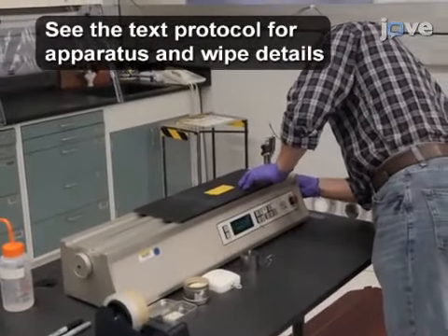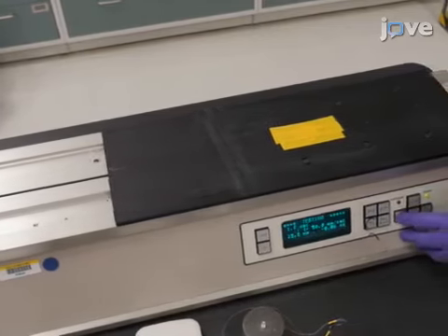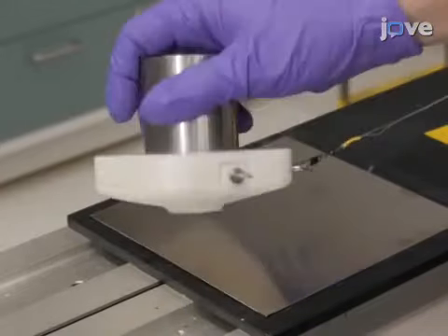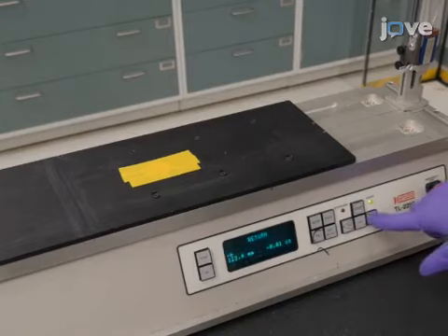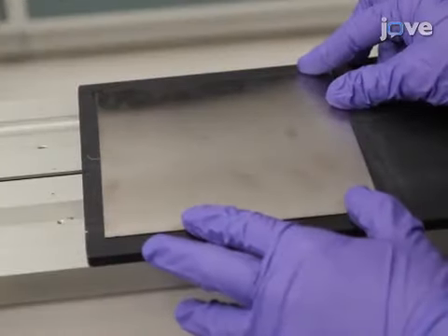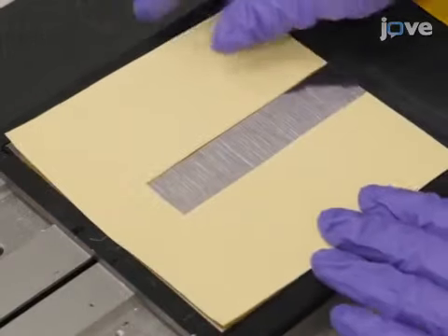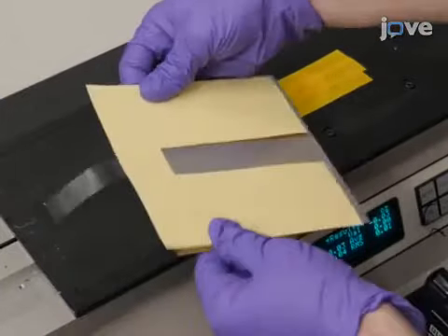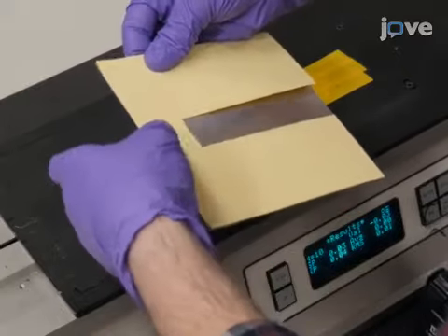The test apparatus is designed with a movable plane that secures a prepared test wipe. After preparing the apparatus for use, configure the wipe sampling procedure. First, move the plane to the starting position and place a test surface on the testing plane without adhering it. Then, place a paper template flush to the edges of the test surface and adhere it there with tape. The template marks the start position and the sampling path.